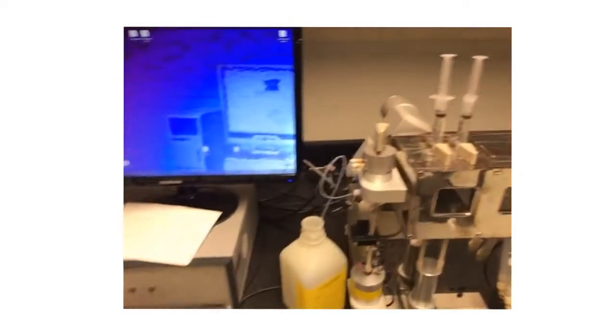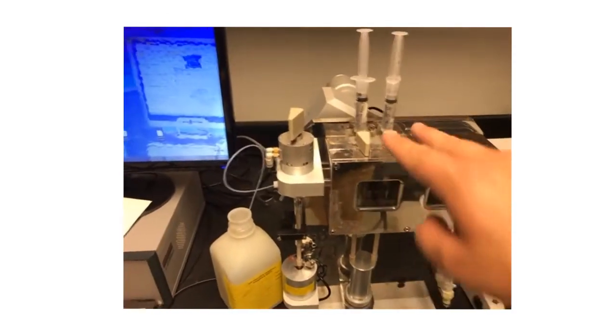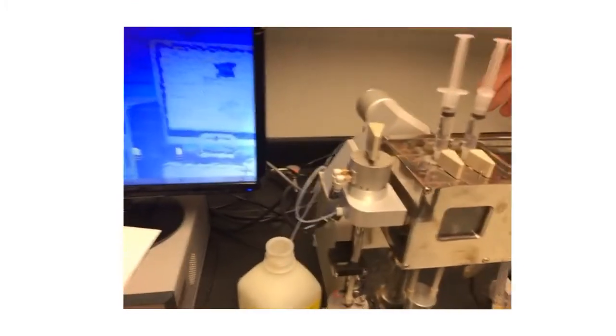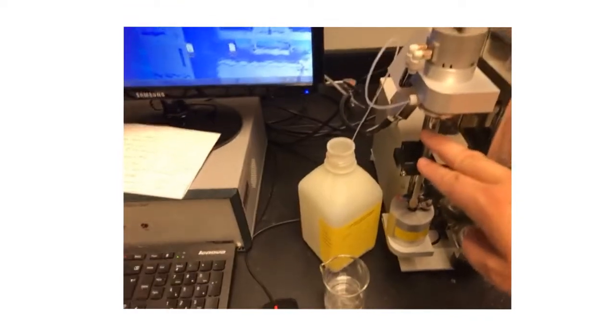So then what we'd want to do is actually saturate the lines of those liquids leading to the reaction area, where they're going to mix together, do whatever reaction they do, and then eventually lead to the drain port and then our waste container.